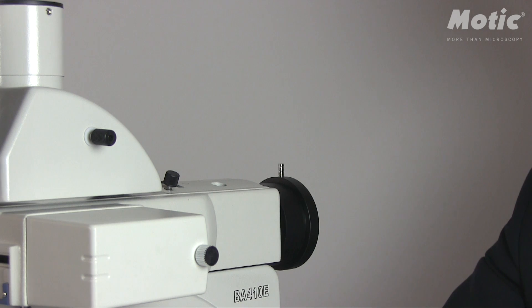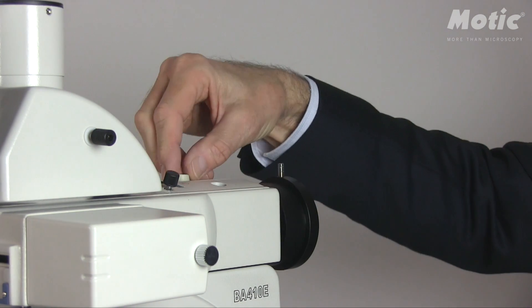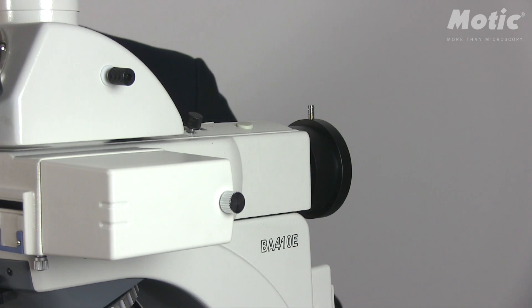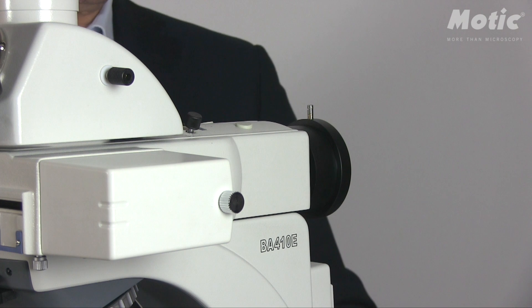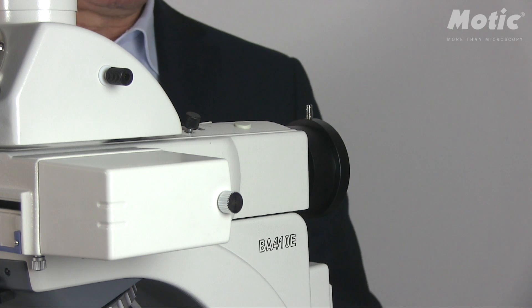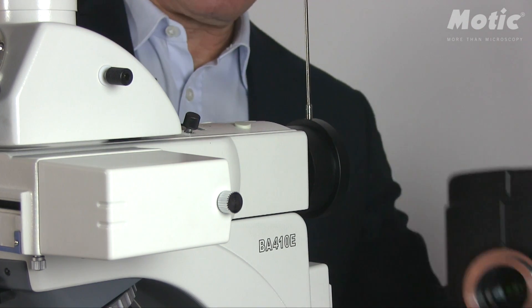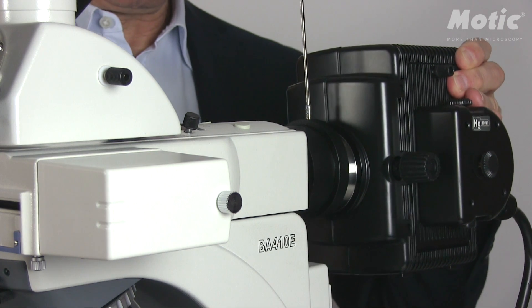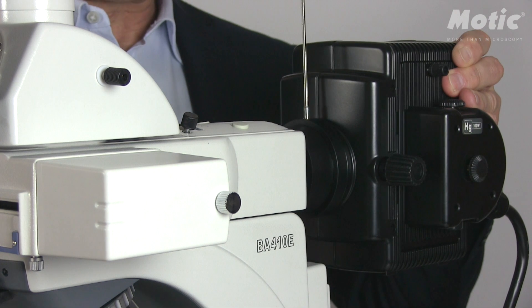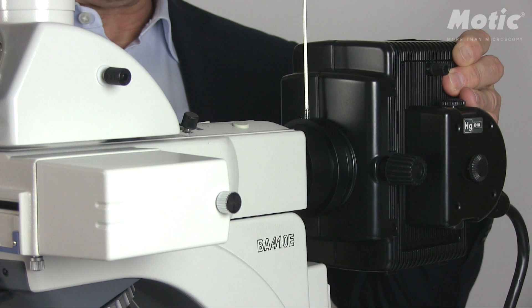At the end you may cover the holes with those tiny little rubber pieces. The final procedure in step one is the mounting of the pre-aligned lamp house. Take the Allen key and the lamp house and fix it firmly at the end of the attachment. There is only one possibility to fix it in the correct way — there is a notch and an orientation pin.